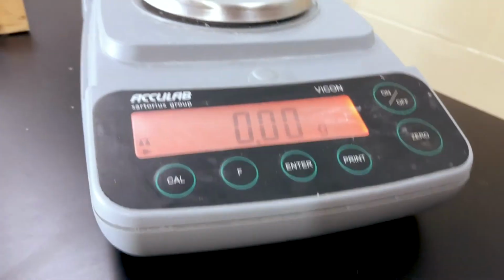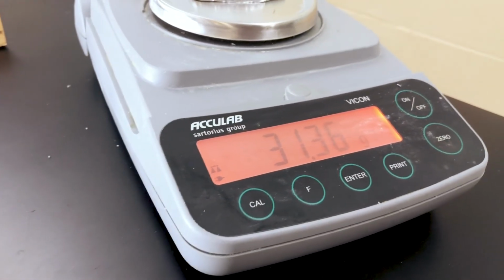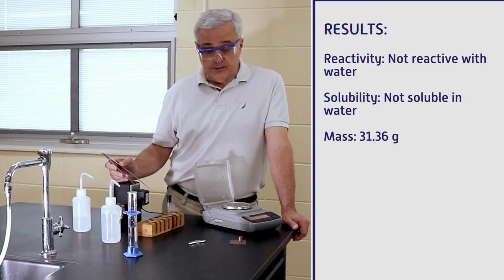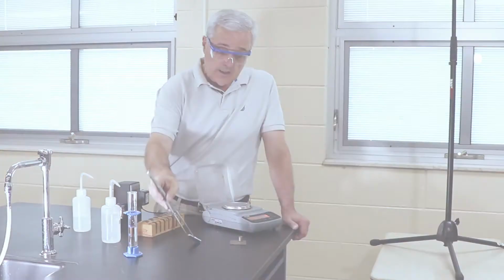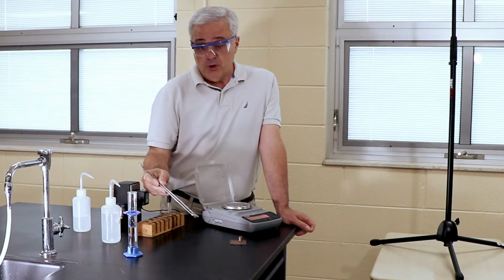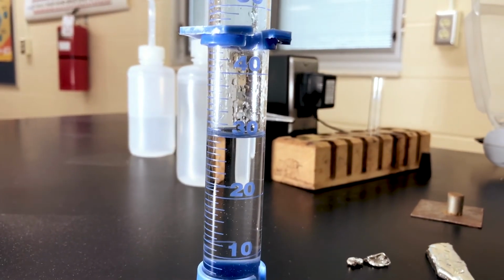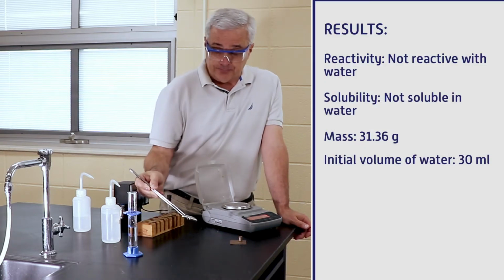With regards to the mass, we put it on the scale, and here are the results from that. 31.36 grams is the mass that we came up with. So that's going to be your mass for the sample. With regards to displacement, our initial volume was 30 milliliters. Exactly. We set it up that way on purpose. We made it 30 milliliters to start with so that it would be easier to determine the volume.